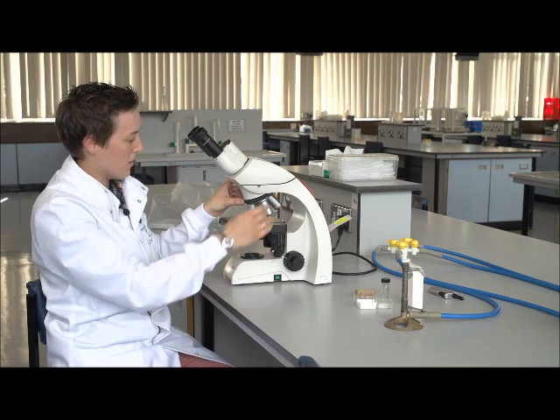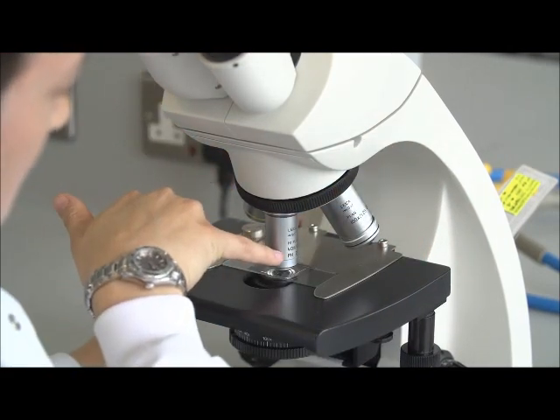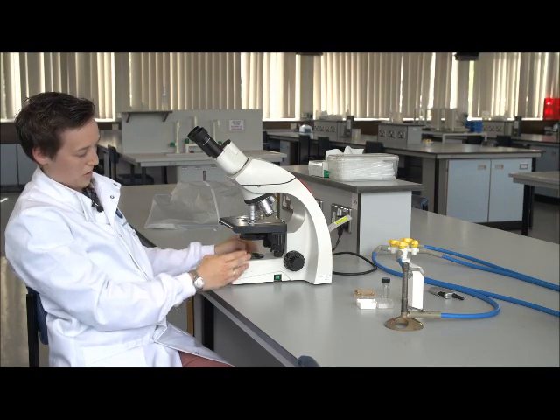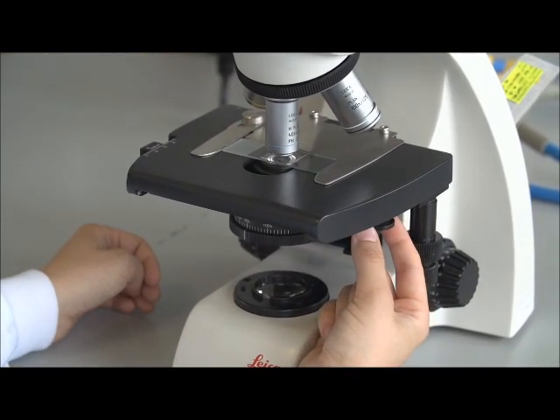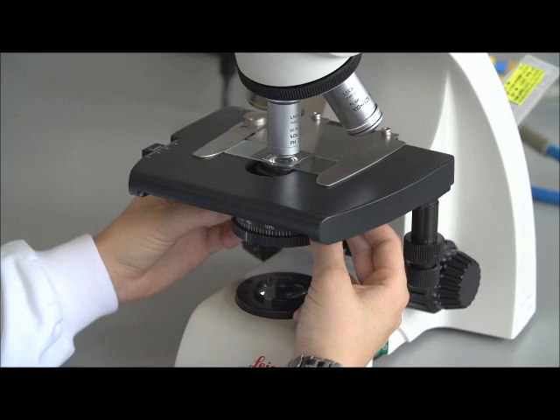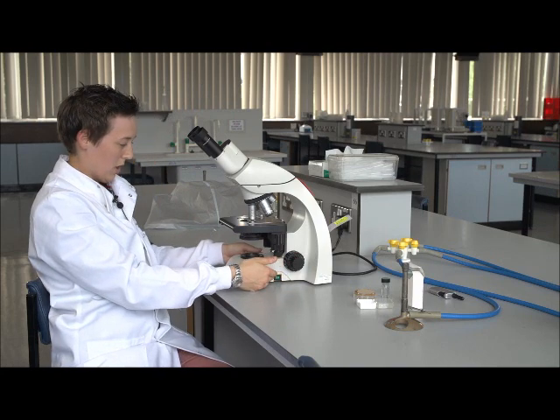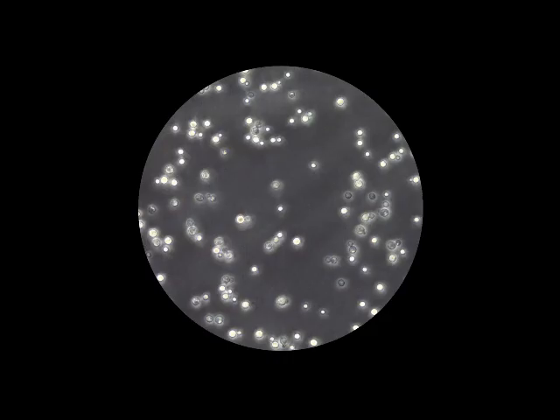Once we're happy at 10 times, we can then also go up to 40 times. Now the 40 times has got phase ability with this Ph that's on the objective. So for this, we need to make sure again that the aperture underneath is allowing enough light through, and we also need to push our phase ring in underneath here. So under the stage, we push this in and you'll hear it click into place. And again, we can find our sample. We may need to add more light for phase as we've gone up in magnification and introduced a phase ring, and then we can find our sample again.